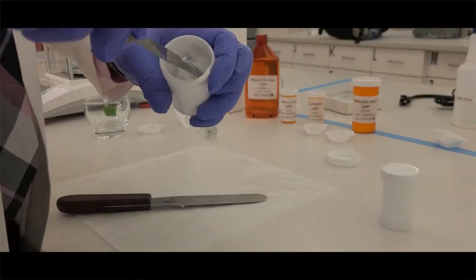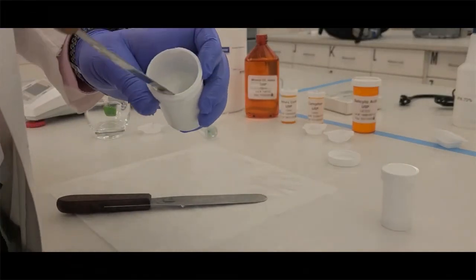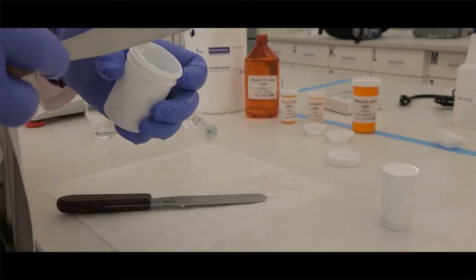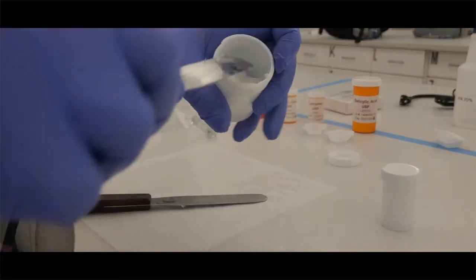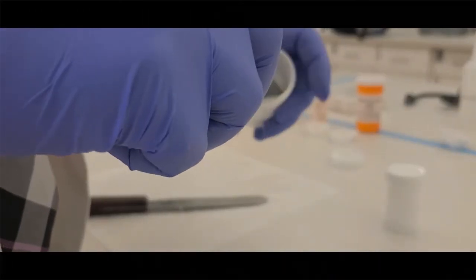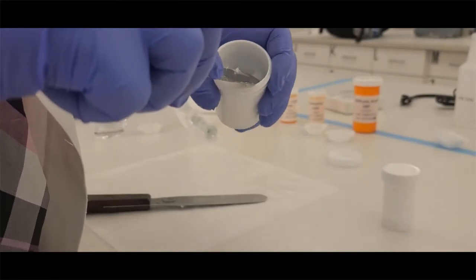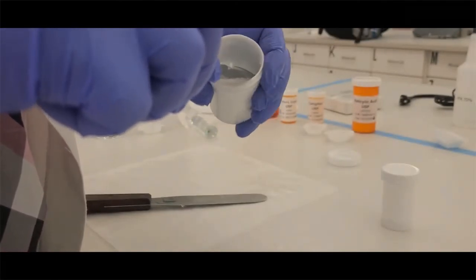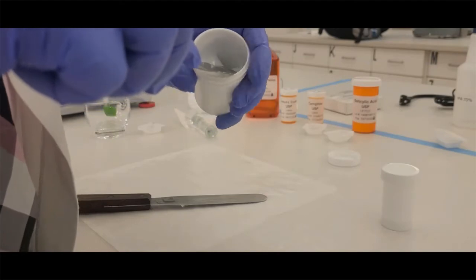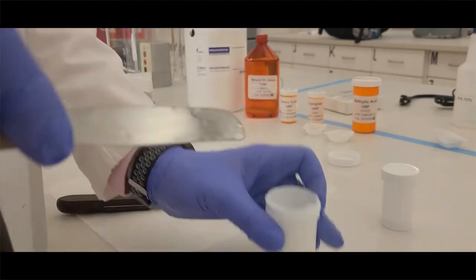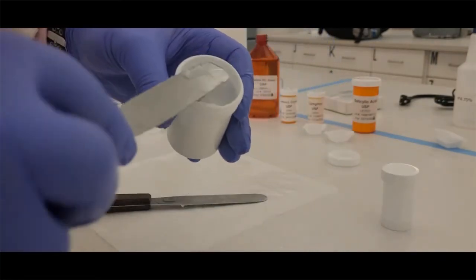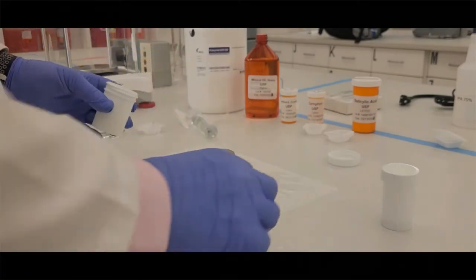Now, you can sometimes scrape the edges to push some of the ointment down towards the center. It makes it look a little more elegant when a patient opens up the jar. Nobody likes to see everything on one side or big holes in it. So I'm going to do that here and show you. But even when you do this, it still doesn't look as perfect, I think, as people would want. But over time, that ointment will settle to the bottom and it will look nicer.